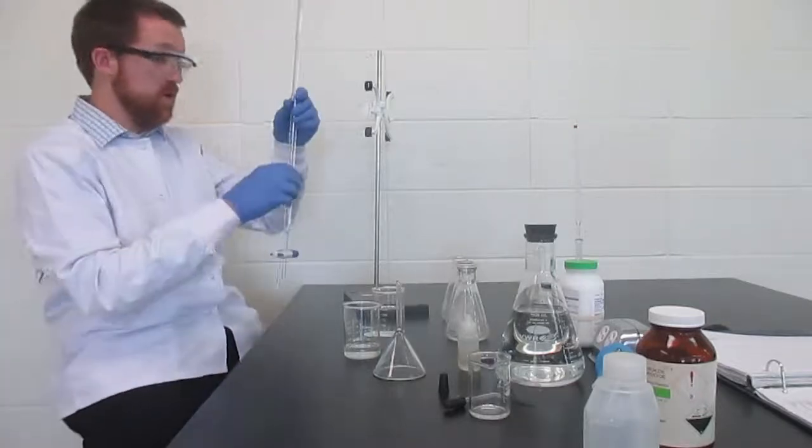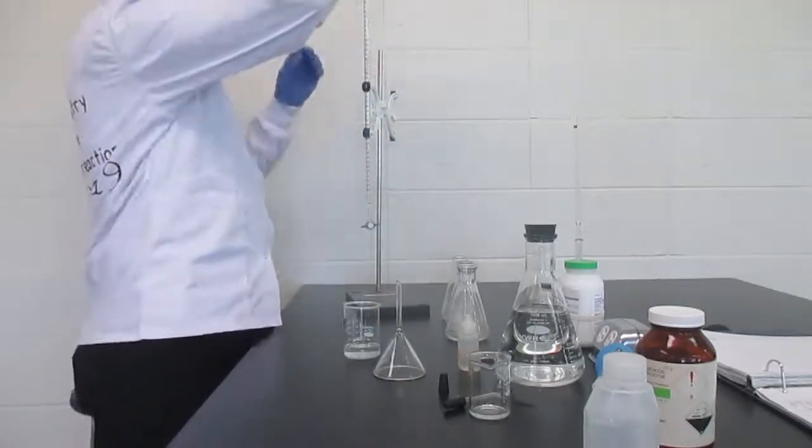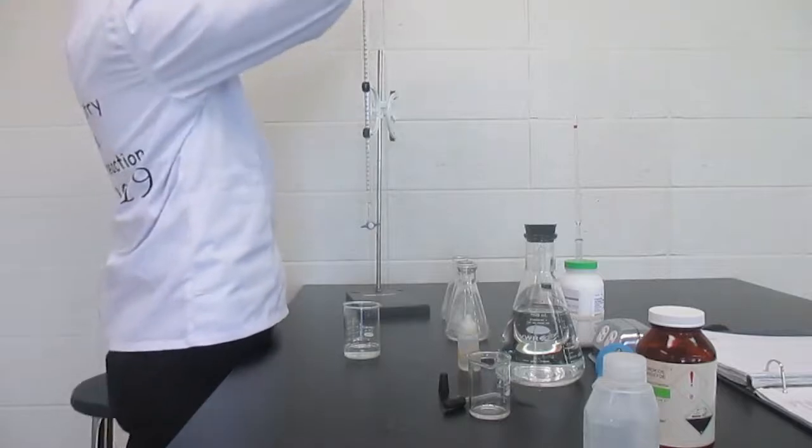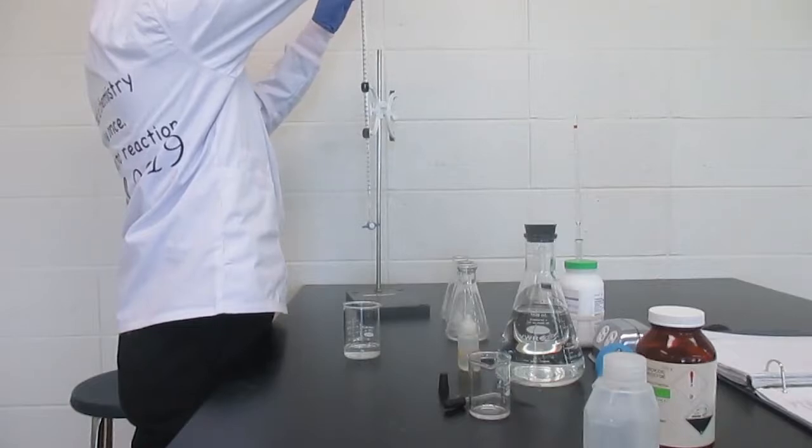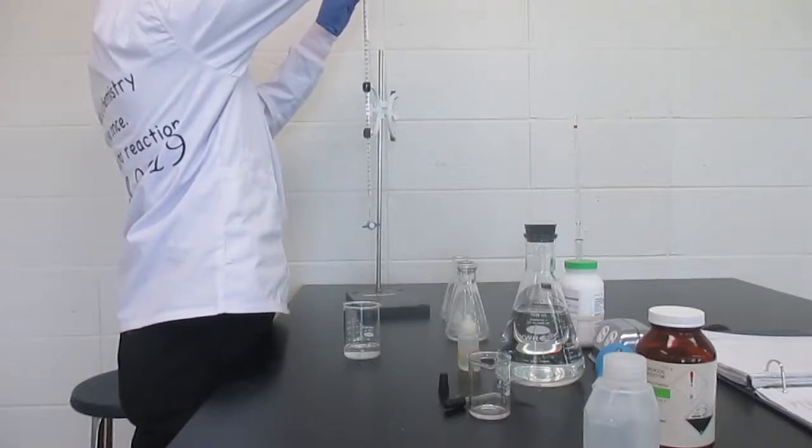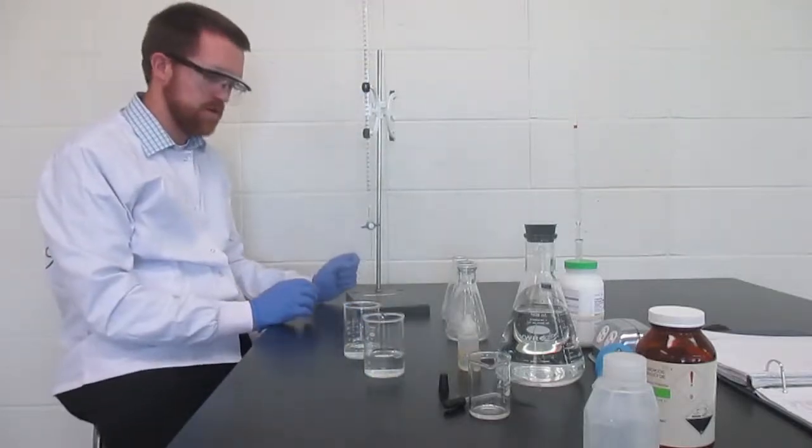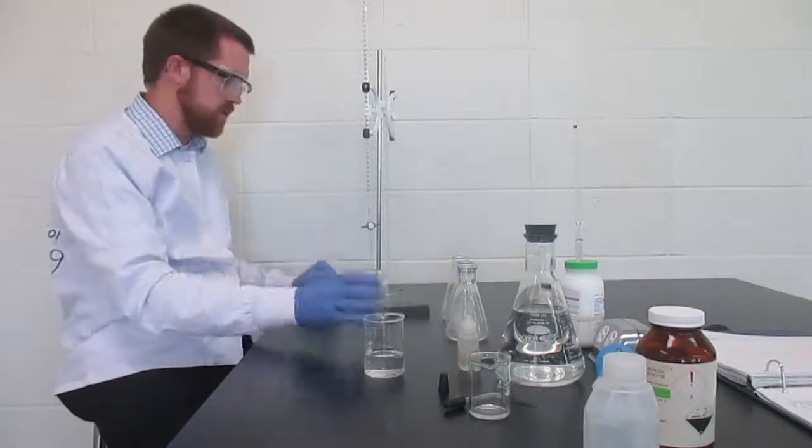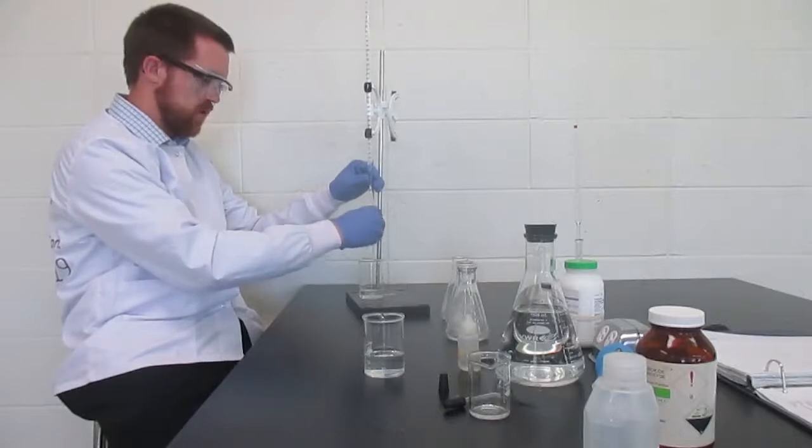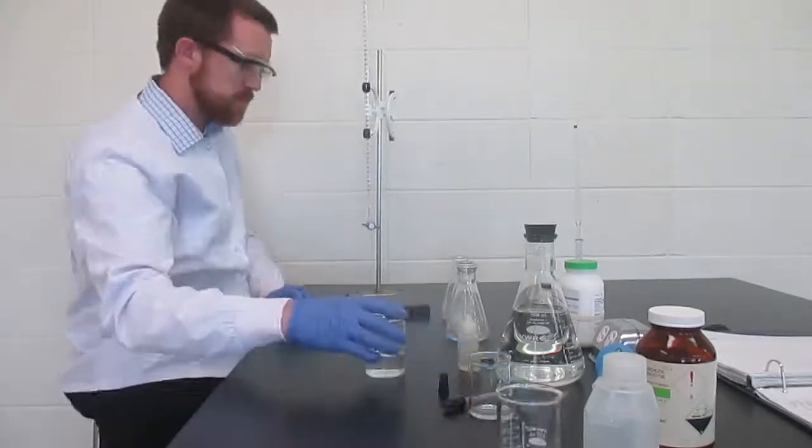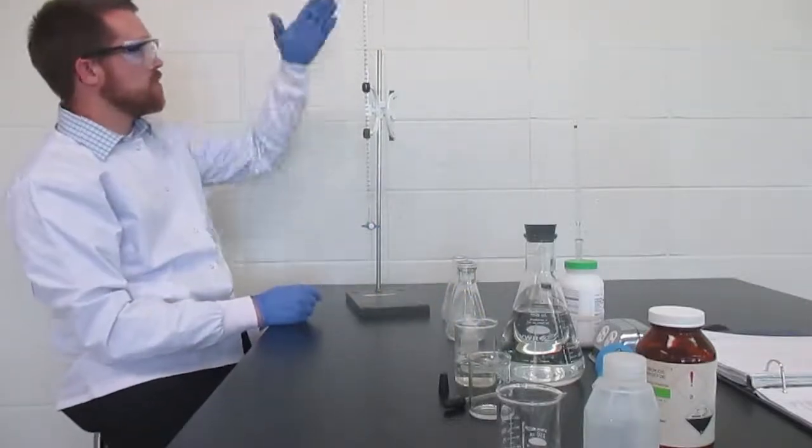Waste beaker here. It's a good idea to label your beaker so you don't forget which one is which. The biggest thing to watch for is that you don't go over the zero line. It fills faster than you think because it's really narrow. One last step. In the tip is still material that should actually belong in my waste beaker because that was from sheeting it. I'm going to let some flow through the tip so that all gets washed out into my waste beaker. This one is waste, and this one is potassium hydroxide.